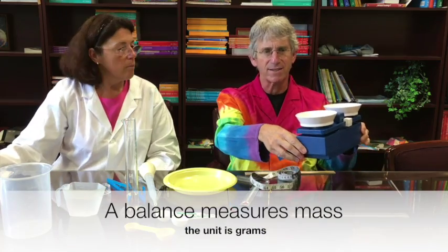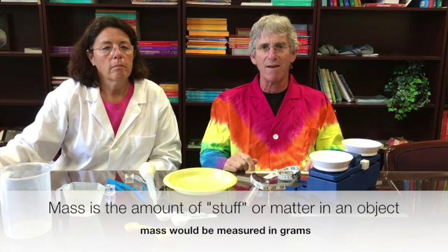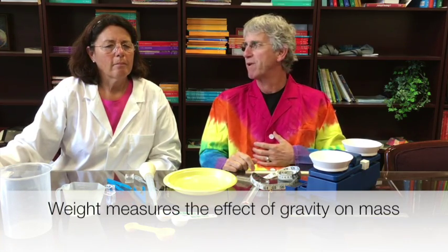Some of the kits have a pan balance, which is to measure mass. Use the term mass instead of weight whenever possible. Mass is the amount of stuff or matter that's in an object, while the term weight actually refers to the effect of gravity on the mass. In other words, if I were on a planet that had less gravity than Earth, I would weigh less, but my mass would remain the same.